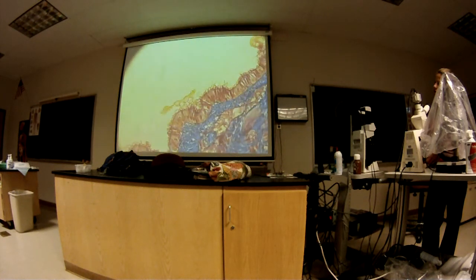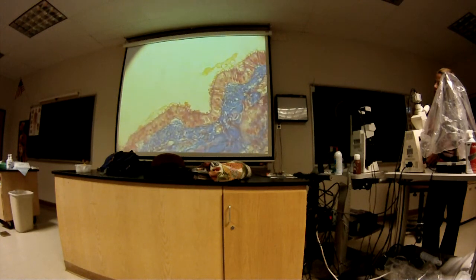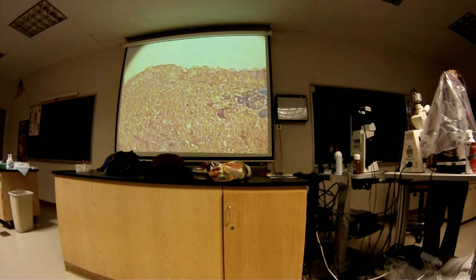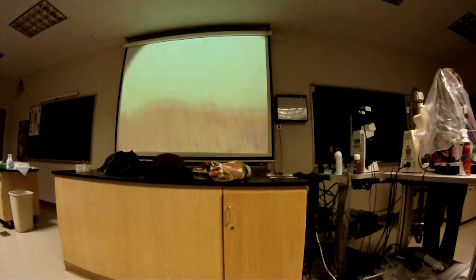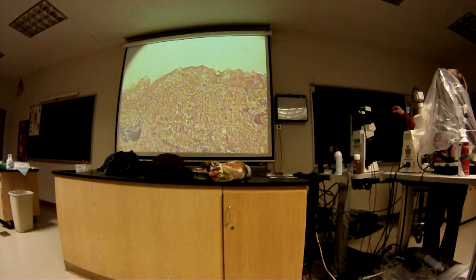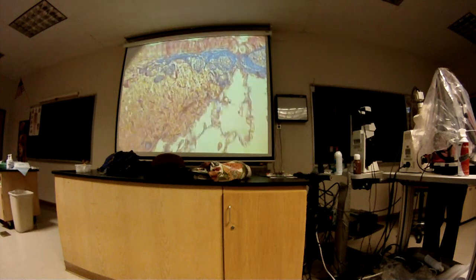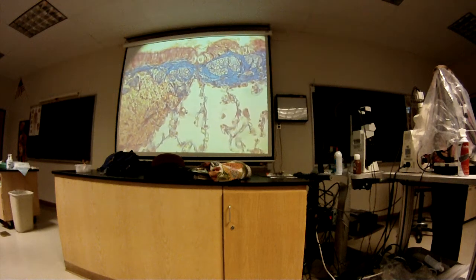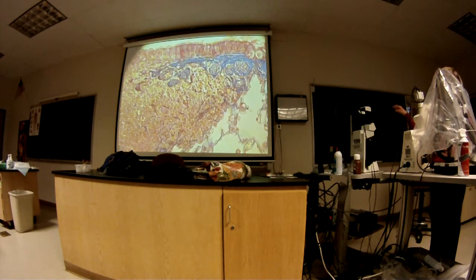So is the epithelium also on the surface of the lymphoid nodule? Well, it looks like it penetrates all the way to the inside there, kind of splits it. See that? Looks like it. No epithelium right there. There it is. See it right here. Nice picture right here. Here's the cilia, pseudostratified ciliated columnar epithelium, lining the bronchus. And this is the lymphoid nodule.